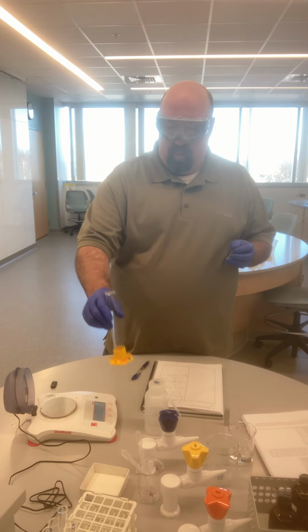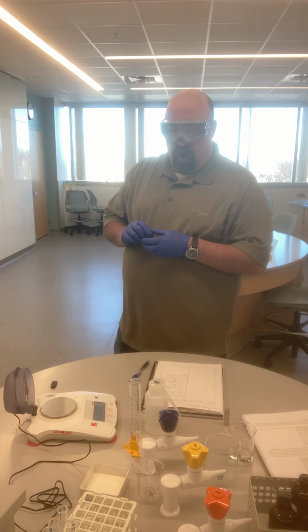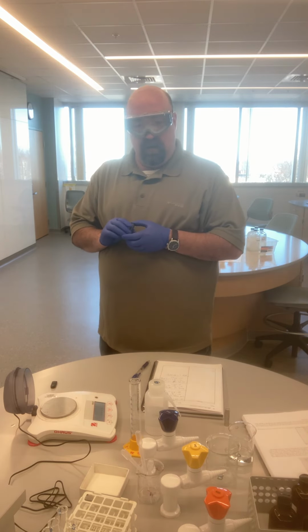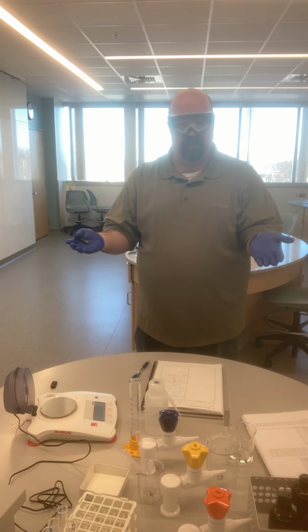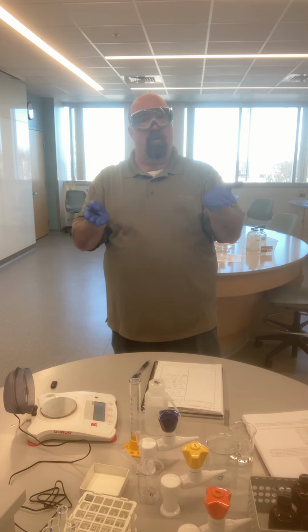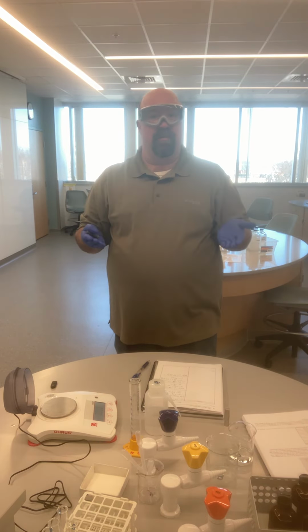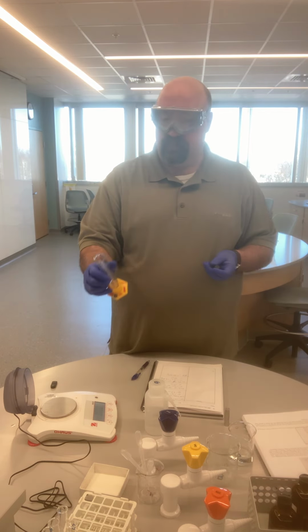And so what I can do is use a method called water displacement. In water displacement, think about what happens when you get into a bathtub. You get into a tub, sit down, and the water rises up. The amount that the water rises is the volume that you are displacing. And so we can try to do the same thing here.